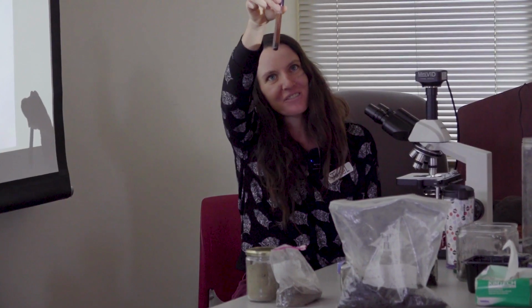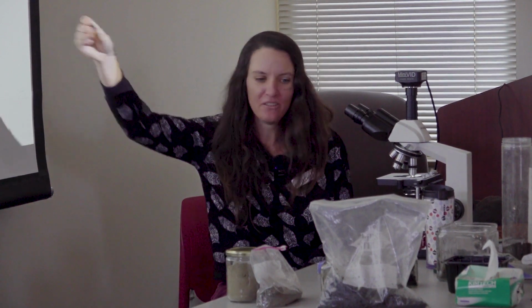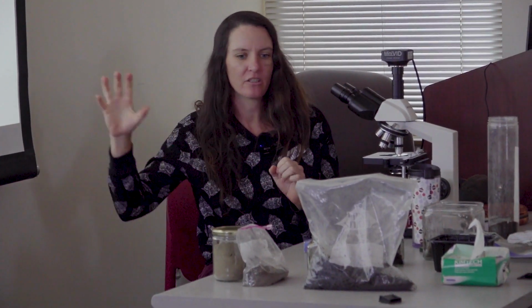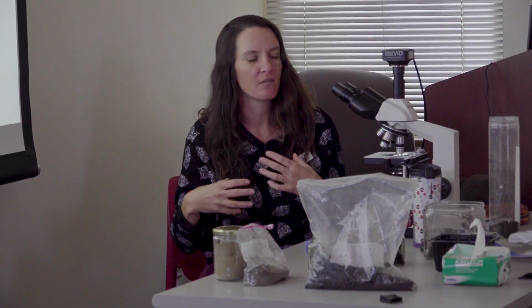It's the same stuff that was in this test tube. So see that same color? That means that your compost is starting to mature. These materials have been broken down to that super core structure, and it started to pull in other materials from your compost substrate and create these aggregates. So these micro aggregates eventually will start to form macro aggregates once you get them into your soil.